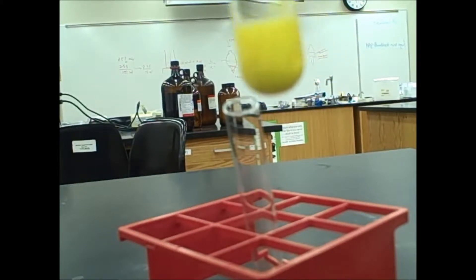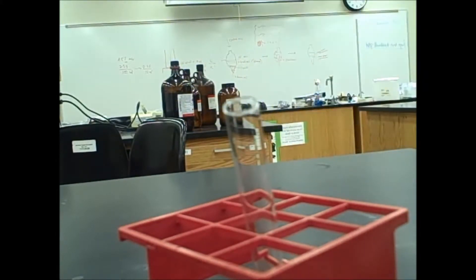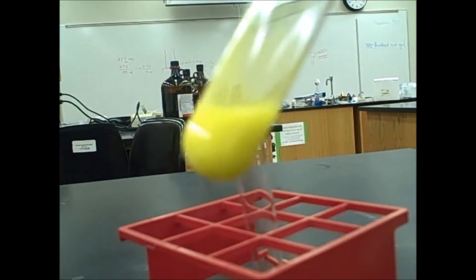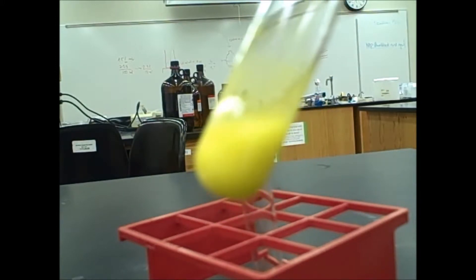So what do we see? You can see here that we have formed a liquid here, but you can clearly see that there's some yellow solid forming here.